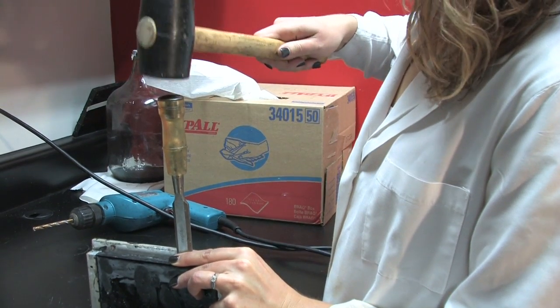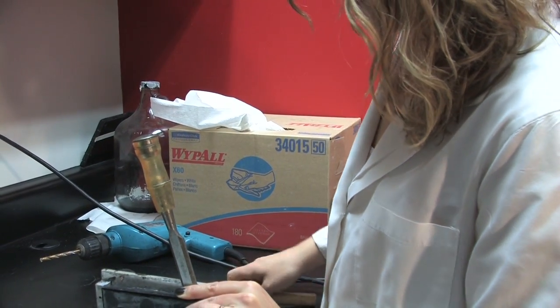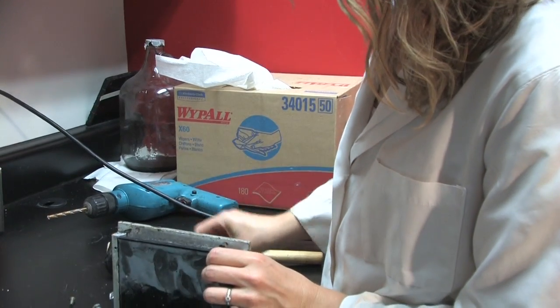To remove the plate, you might have to use a chisel and a mallet just to pop it free. Just a few taps and it should release.